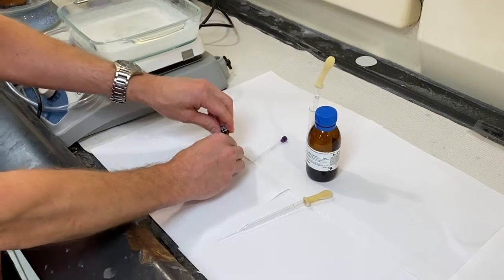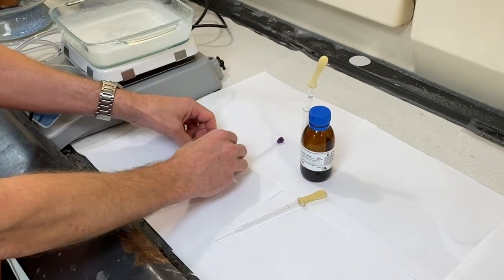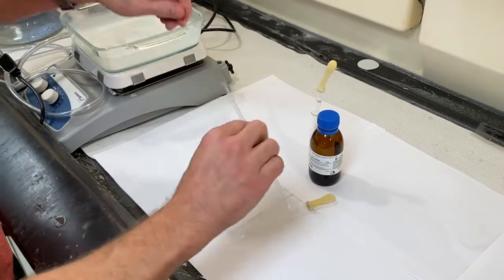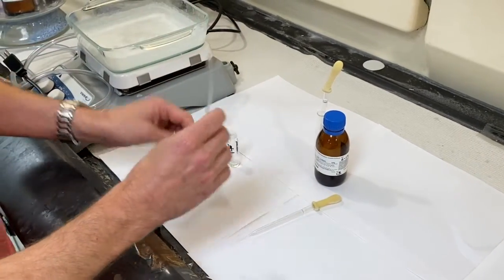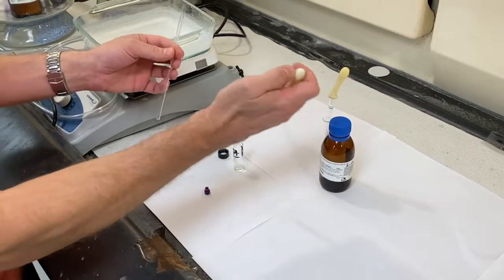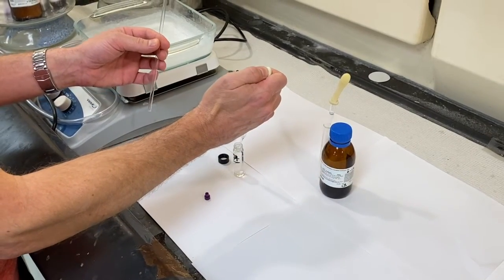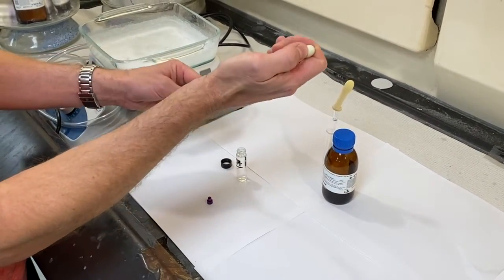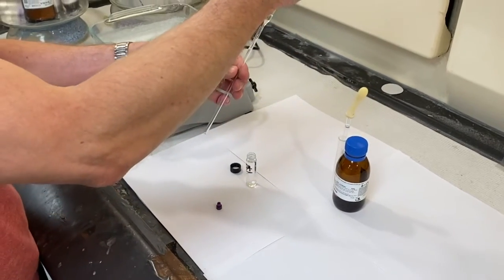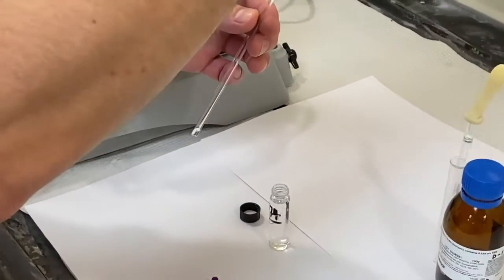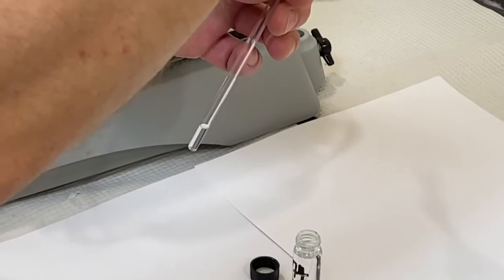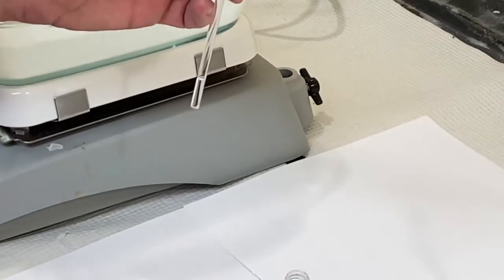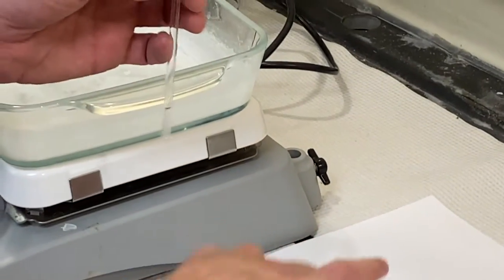First you'll put the liquid sample into the NMR tube. So take the cap off the top of it and you'll put in about a centimeter and a half height-wise of the liquid. The total sample is going to be about four centimeters and about one-third of that should be your sample.